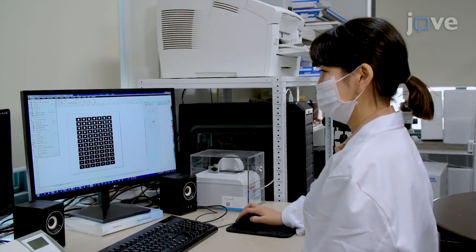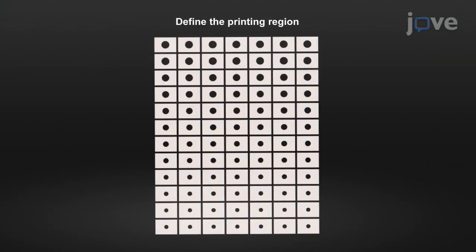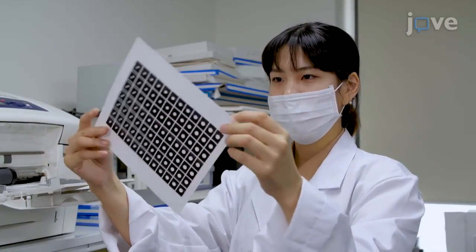Begin by defining the region to be printed with printer software. The design should have 12 wax-patterned layers in which the diameters of the circular sample areas gradually narrow from 5 to 2 millimeters. Then, print hydrophobic wax on the designated regions on both sides of the cellulose paper.